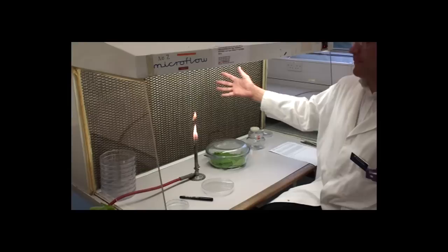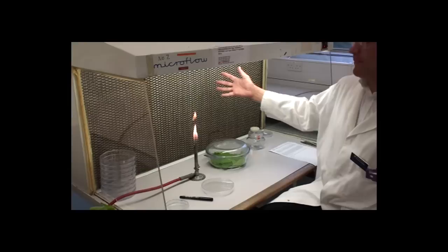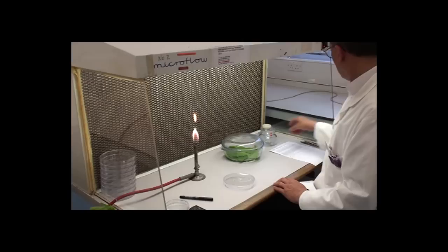We do this in the laminar flow cabinet, which I'm using here, and this has big filters at the back with fans and blows sterile air across me so that there's no bacterial or fungal or other infections.